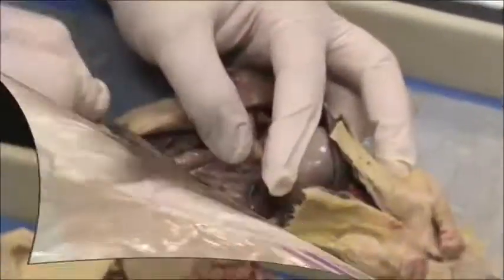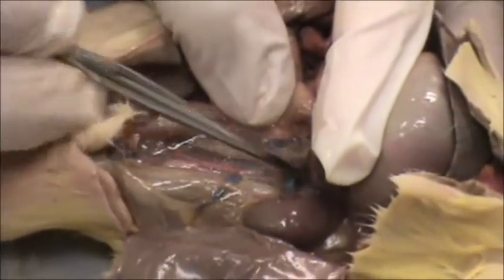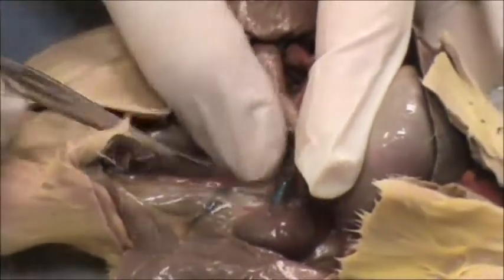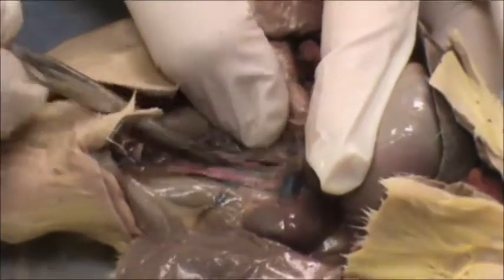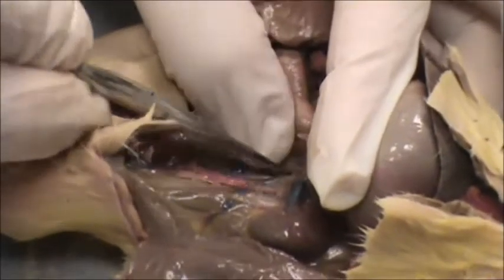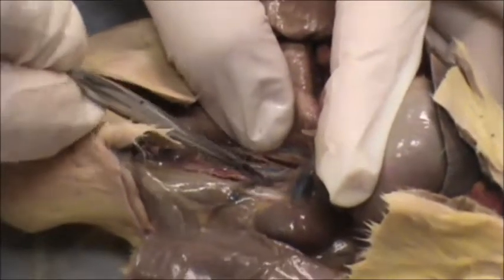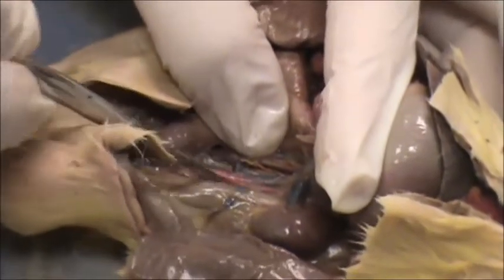At the abdomen, at the very bottom, along the spine you can find the main arteries in the body. The blue one is the vena cava, and the one next to it is called the abdominal aorta.